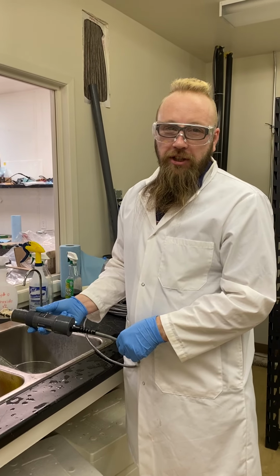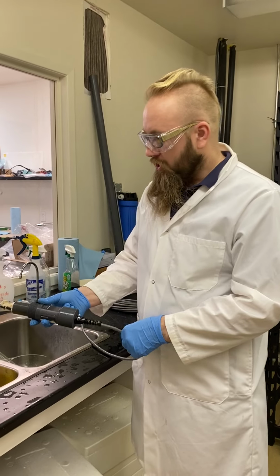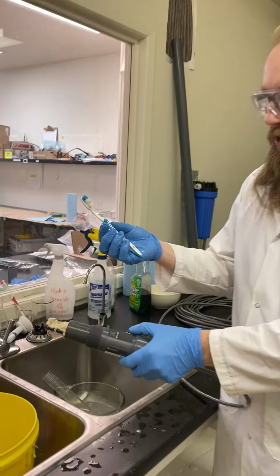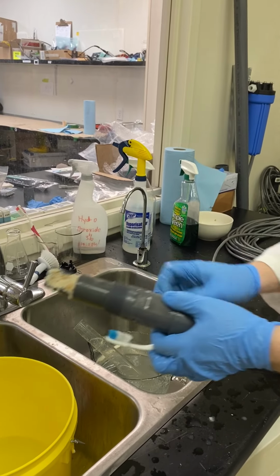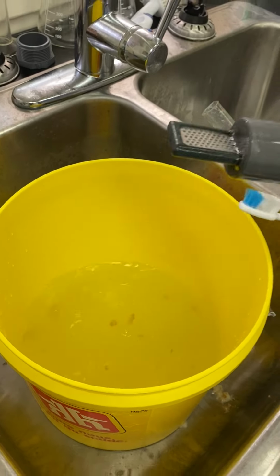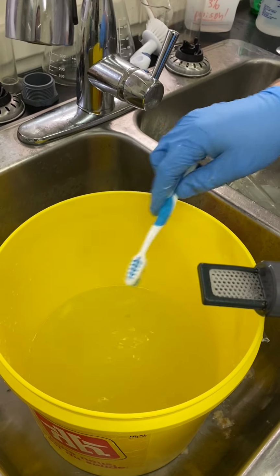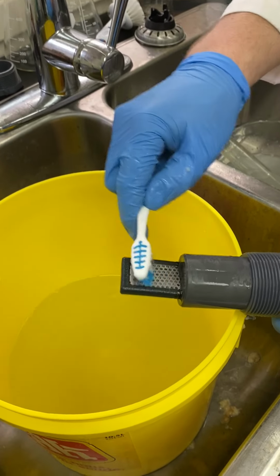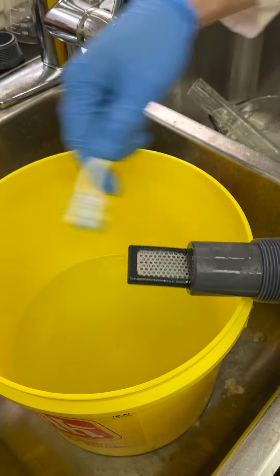If the first stage didn't help, move to stage 2. And you just need a simple brush to clean the electrodes. So after the first stage, it should be pretty much clean here. And the idea of stage 2 is to knock out everything that could be stuck in between the electrodes, like that.